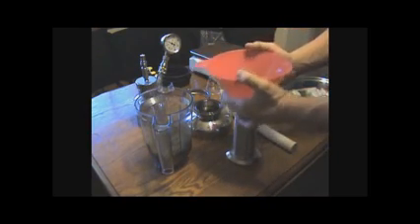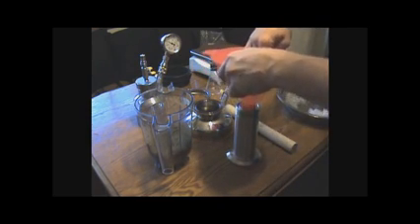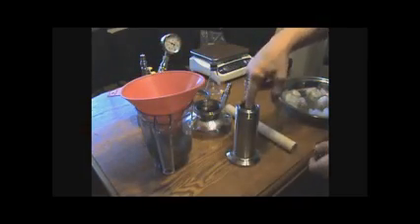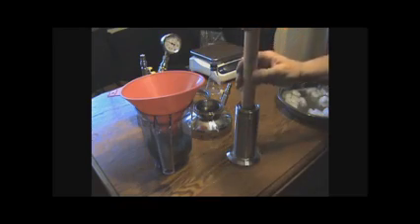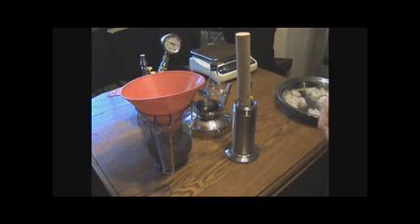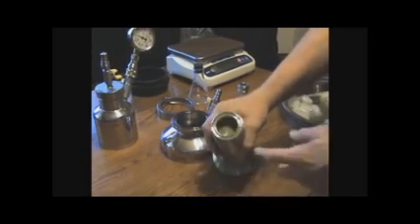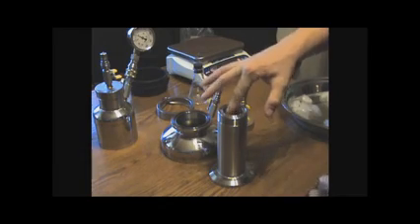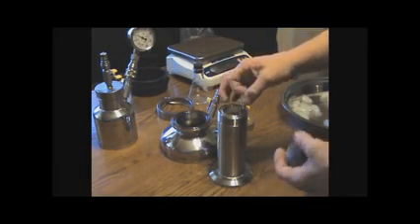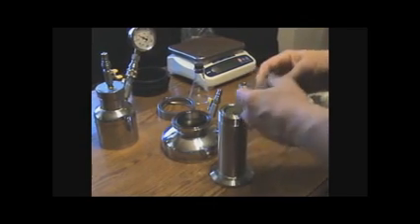Just to show you how tightly I packed this — it filled all the way to the top. I put some weight on it and repeat that until it's full. I got it all in there with a little space left over. It's pretty tightly packed and actually very, very aromatic — a very strong smell since it was ground up with a blender.